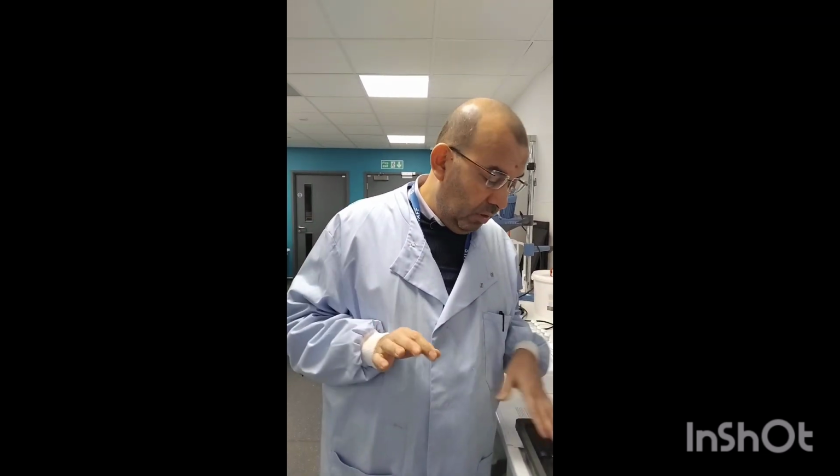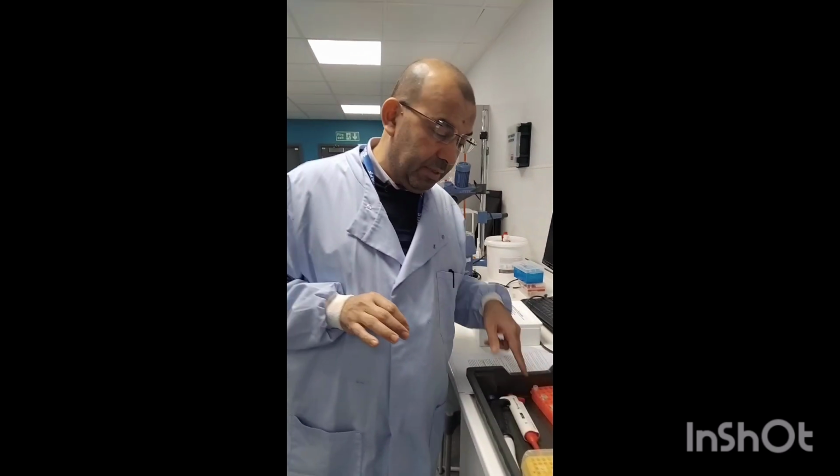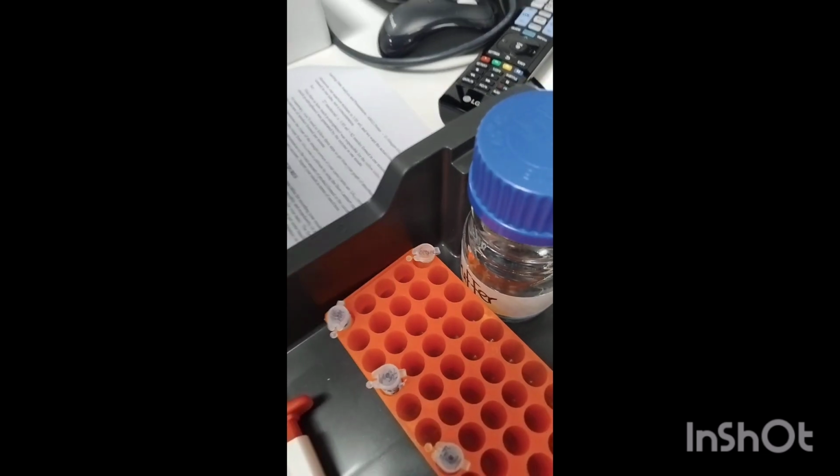Remember, at the experiment, we'll keep the same concentration of the enzyme, which is 25 microliter. Okay, and from section A to section B, we'll change the substrate, but the enzyme will remain the same. The enzyme here in the corner, remember, always the enzyme in the corner.